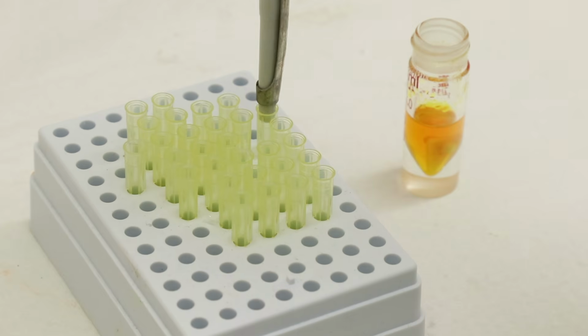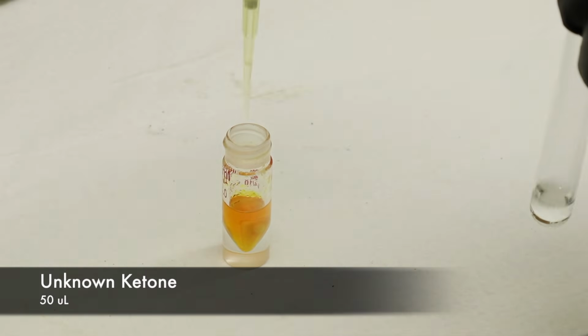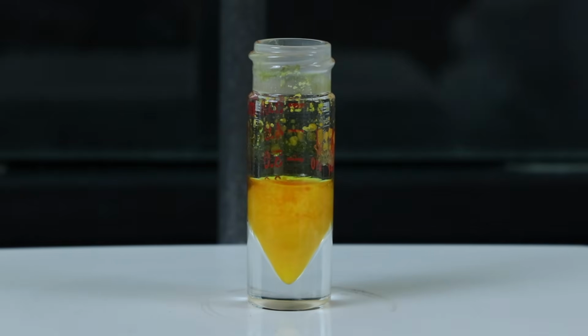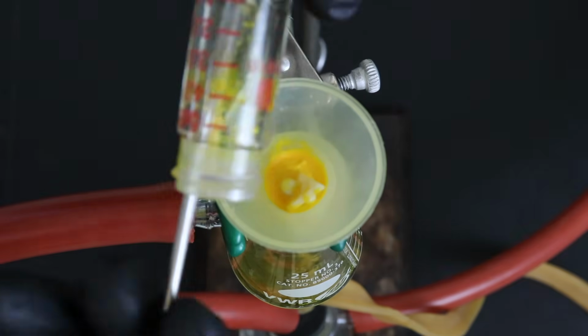Then, using an automated pipette, I'll transfer 50 microliters of the unknown ketone to that solution so it can begin reacting. And you can see the yellow color of the new derivative solid forming as it spins. I'll let that react for a few minutes at room temperature, and once it's done, I can transfer the solution over to the Hirsch funnel to separate the derivative solid.